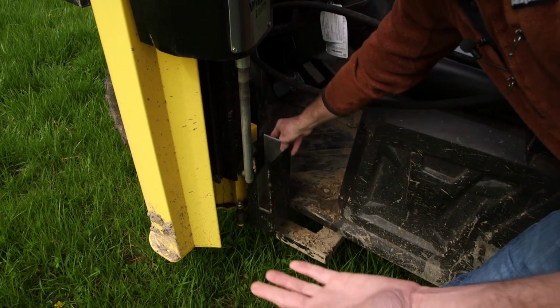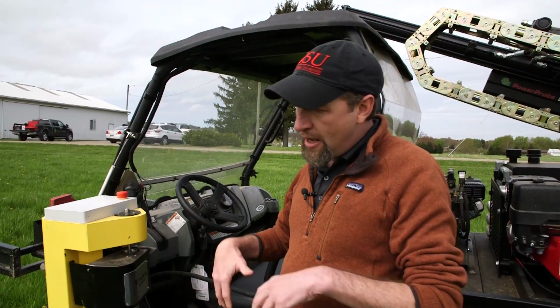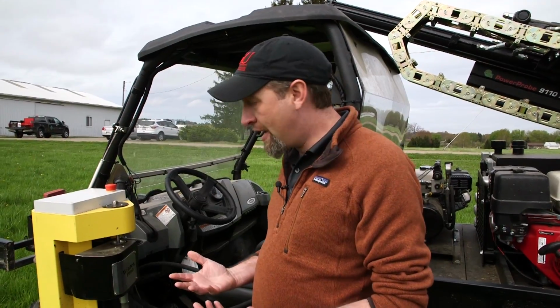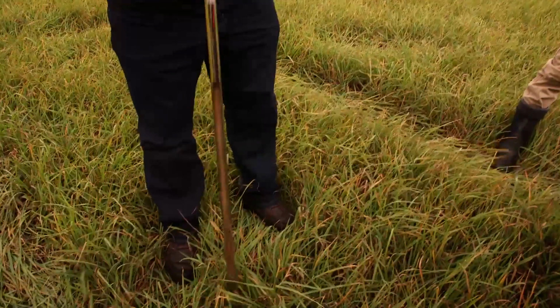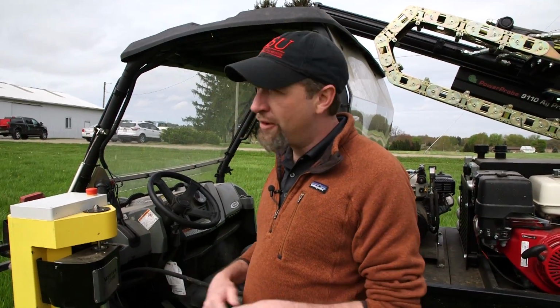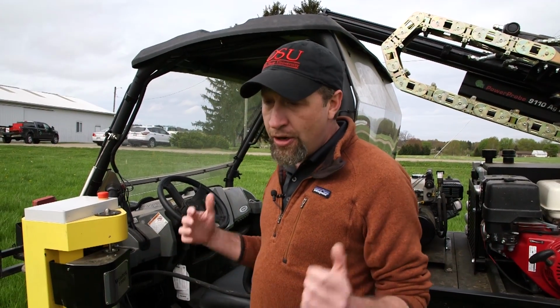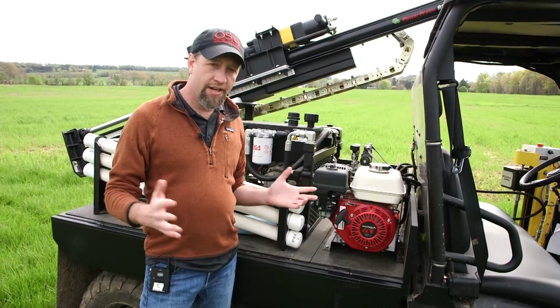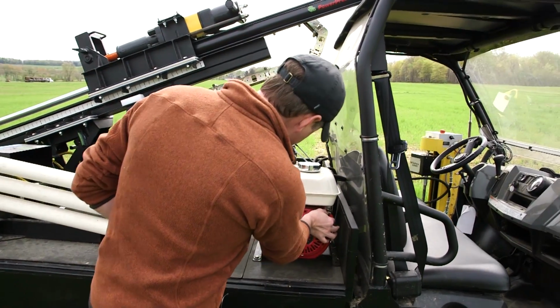And so the real value of this is that we can now collect many more samples a lot more quickly. And it takes a lot of the back-breaking element of soil sampling out of the equation. So for those that are covering lots of acres and having to grid sample, as their career, this is really a great asset to their efforts. All right, so now I'm gonna turn on the hydraulic pump so we can get started.